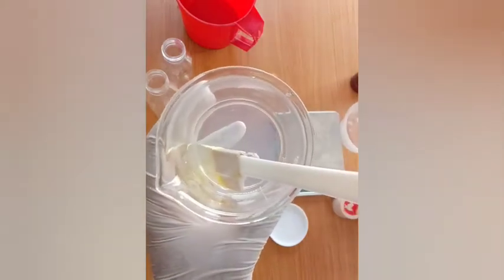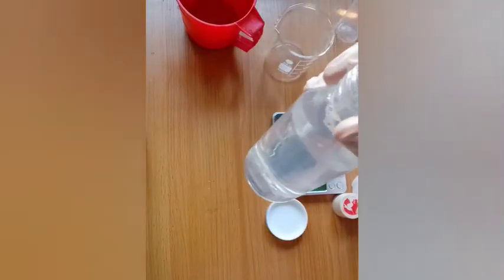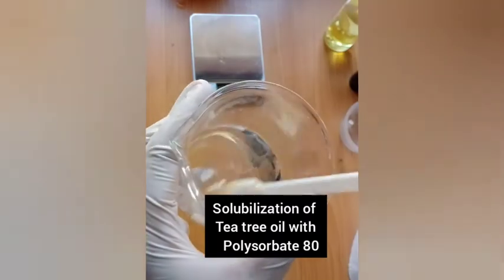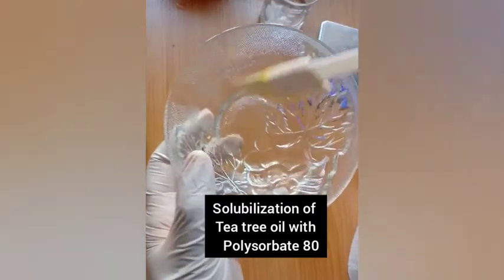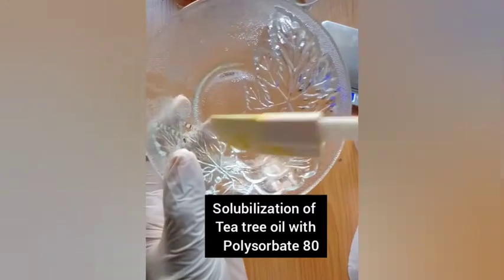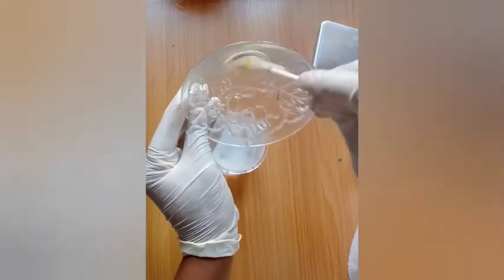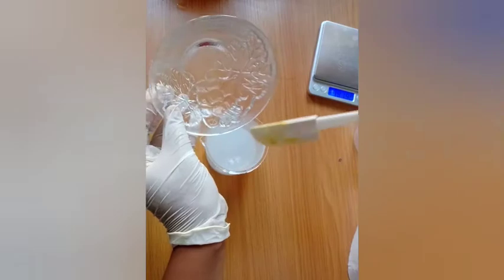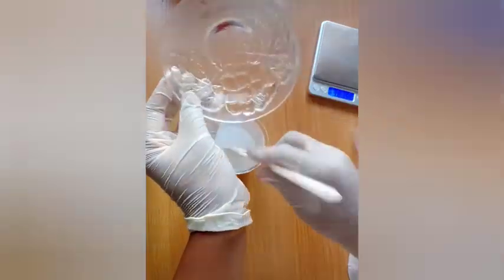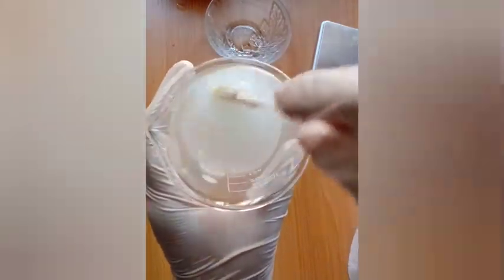You can see how clear and really nice it is. Next, this is my polysorbate 80 solution — trying the same thing. Here I have tea tree oil and polysorbate 80 at a ratio of eight to one. You can see it's mixing into the water but it looks cloudy, and this one doesn't clear up. You need to add more polysorbate 80 for it to work well.